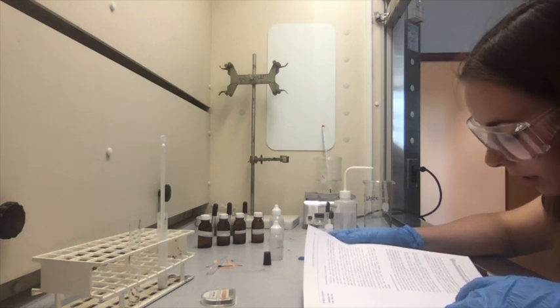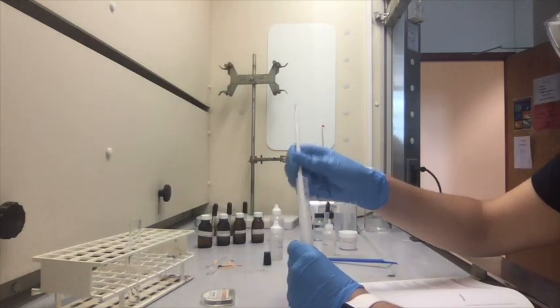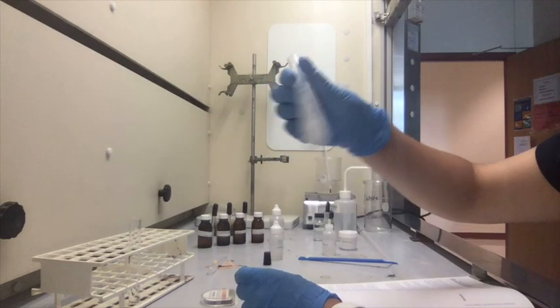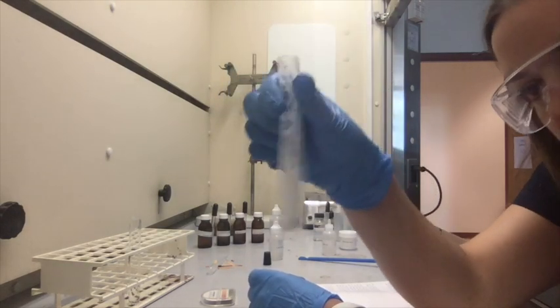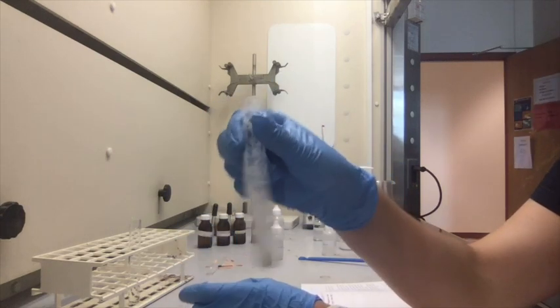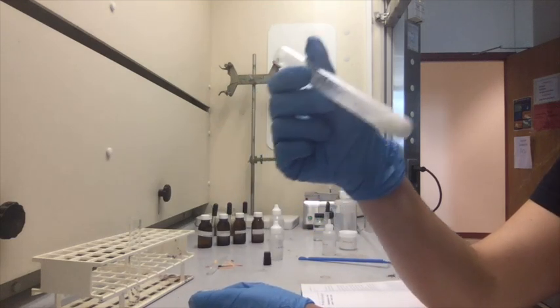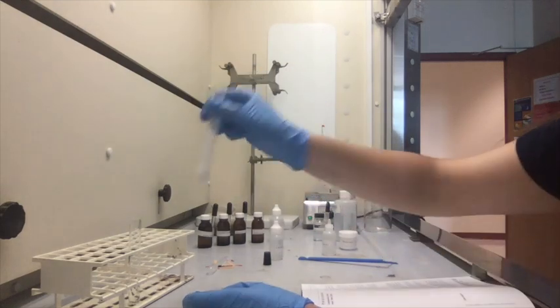As the solution becomes acidic, what do you observe? There's still precipitate, but overall, instead of just 2 layers, 1 clear layer and then the top chunkiness, now it's pretty much white all throughout. Still precipitate, but it's mixed in there quite well.